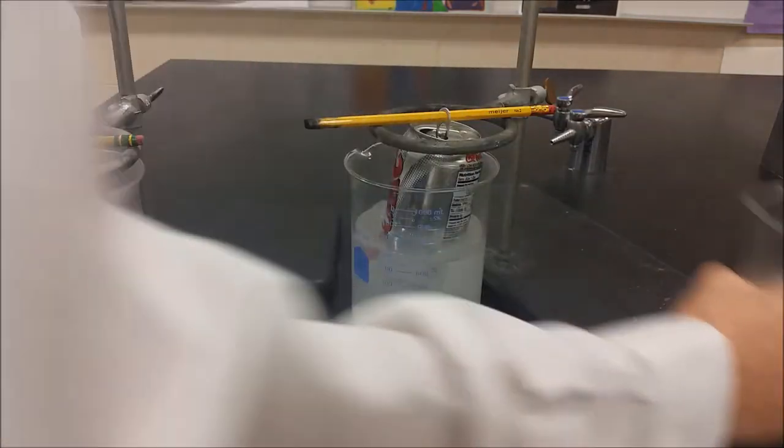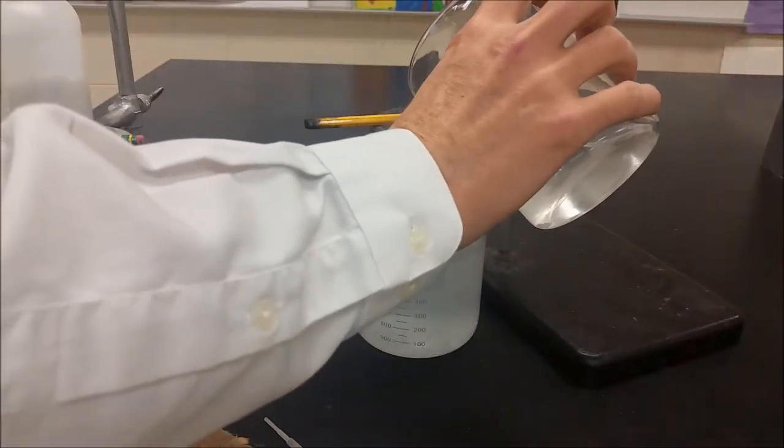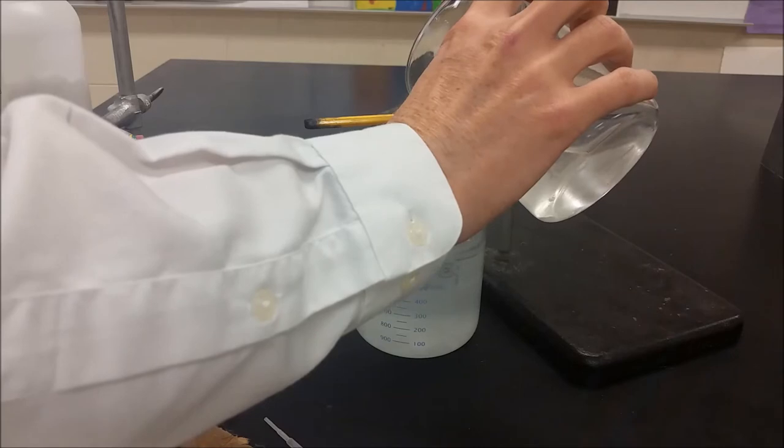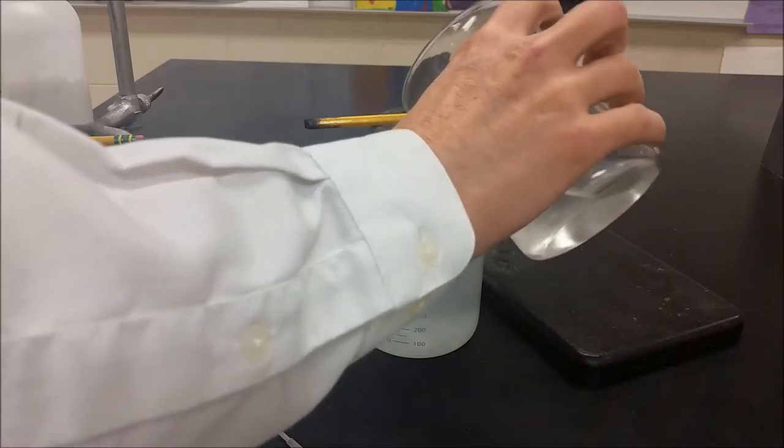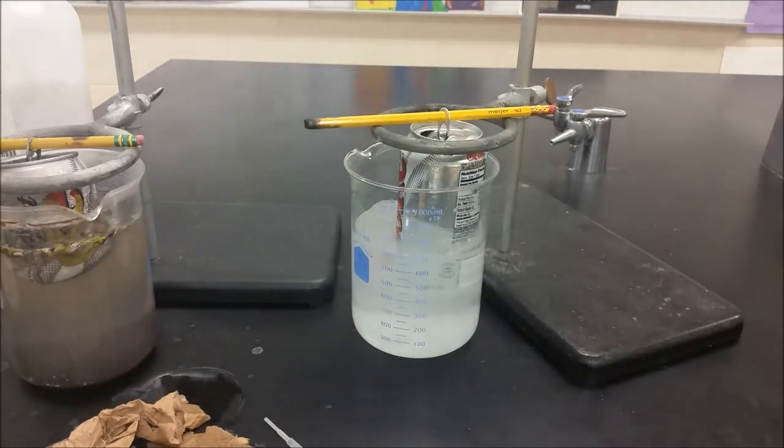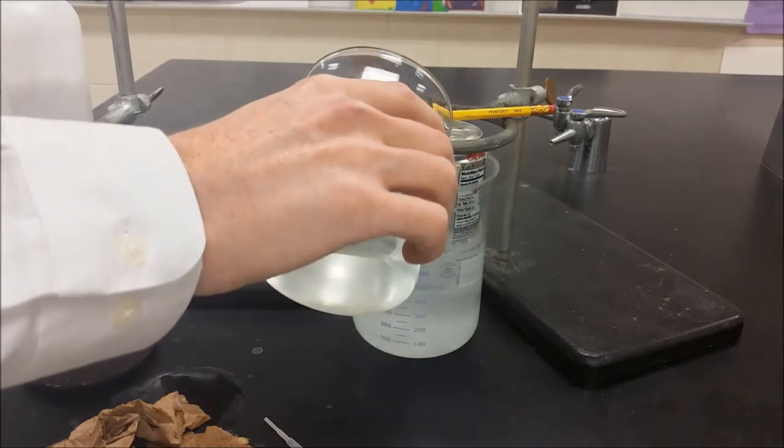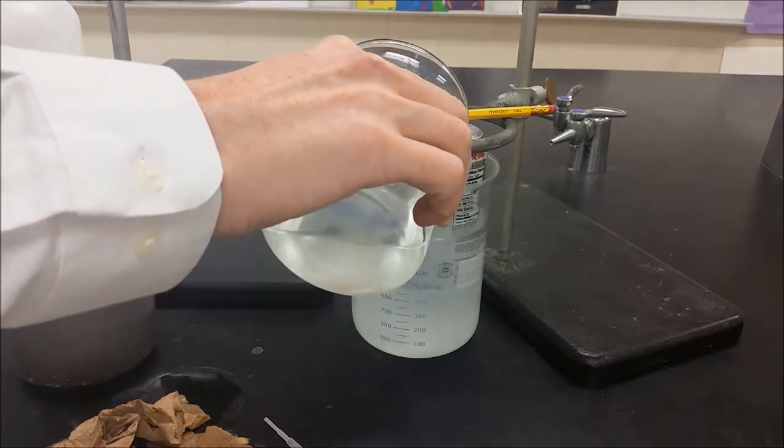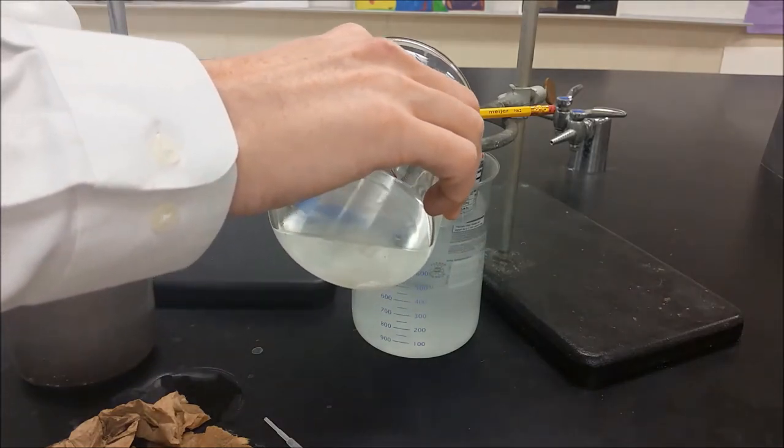Then we're going to add a little bit more hydroxide solution inside and a little bit more outside. We don't want to get too full because we don't want it to be in risk of overflow.